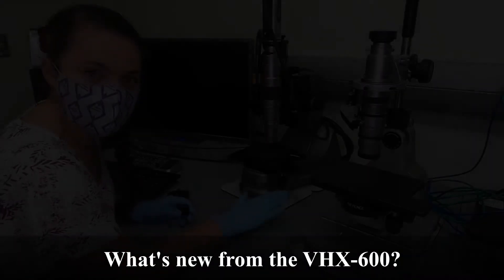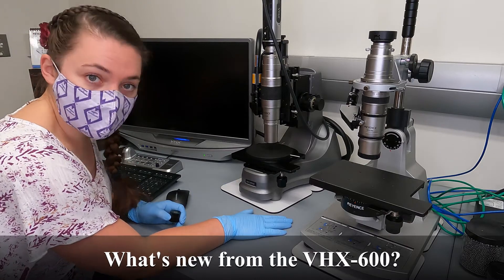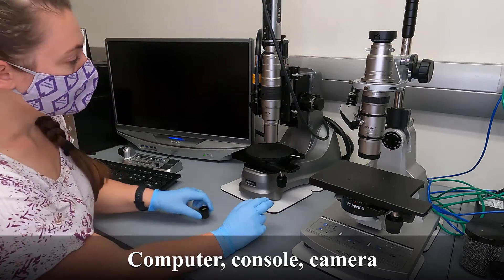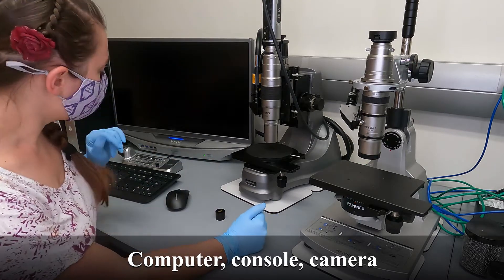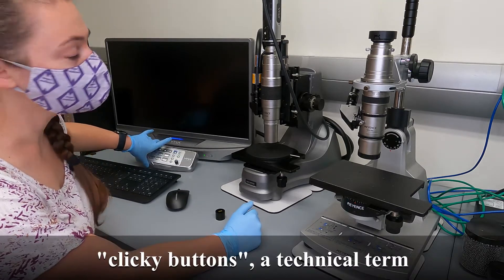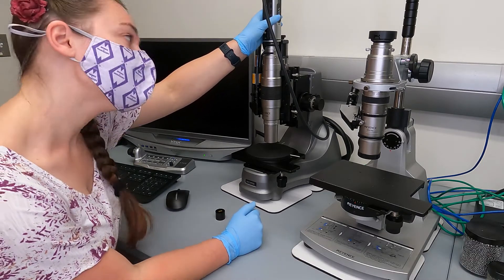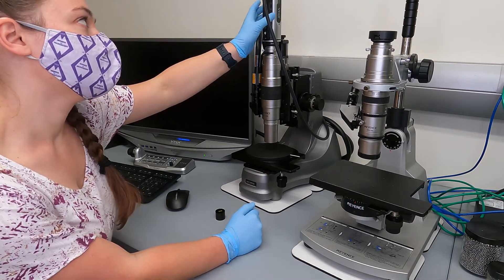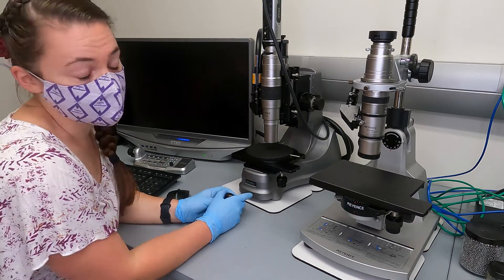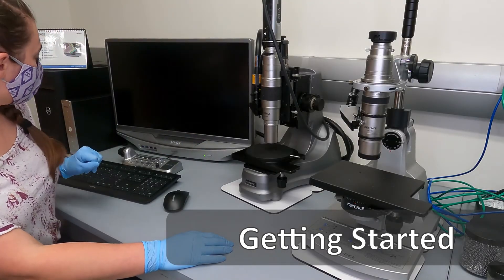The component differences between our VHX600 and the VHX970 are the computer, the console, and the camera. The computer is obviously this part, the console is this part with the clicky button, and the camera is here and will collect the images. It is a much higher resolution camera than the one on the VHX600. The higher resolution unit is shown right here on the monitor.